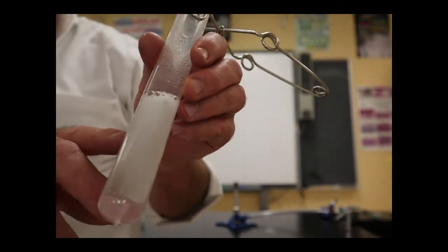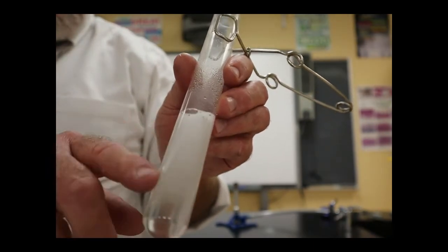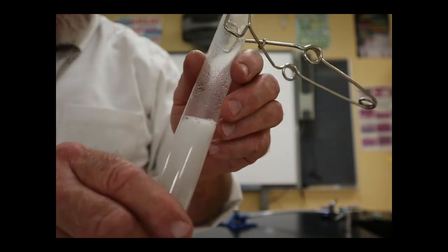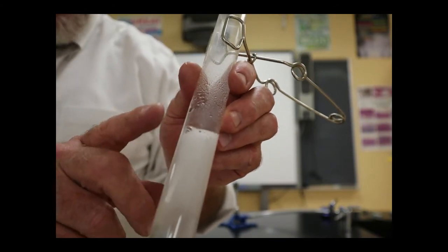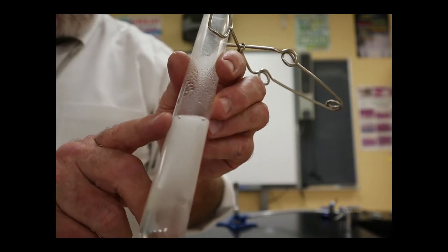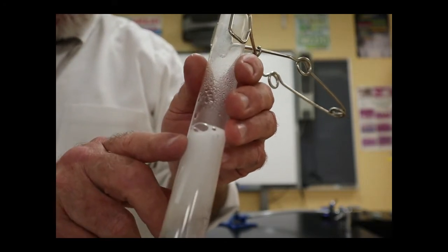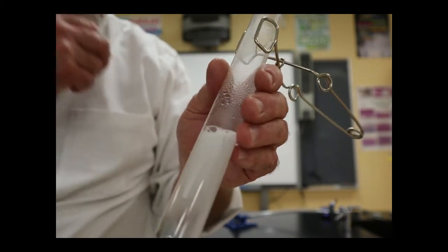Now, what's happening is that those bubbles that are coming up there, that is producing hydrogen gas. So the hydrochloric acid, which has hydrogen in it, has hydrogen and chlorine. And the magnesium, which is a metal, an element, what happens is that magnesium undergoes a chemical change. And it loses 2 of its electrons to become magnesium with a positive 2 charge, or 2 plus charge.